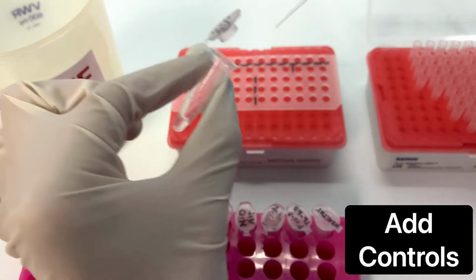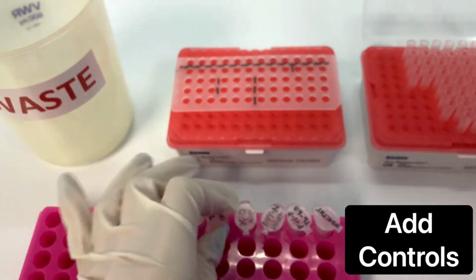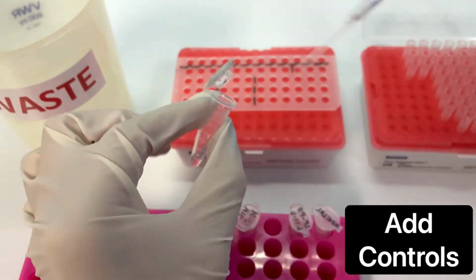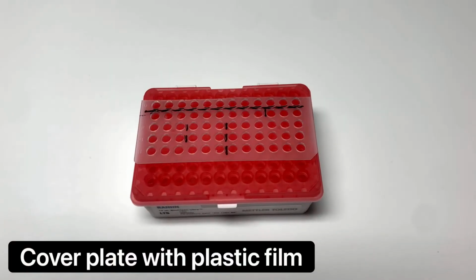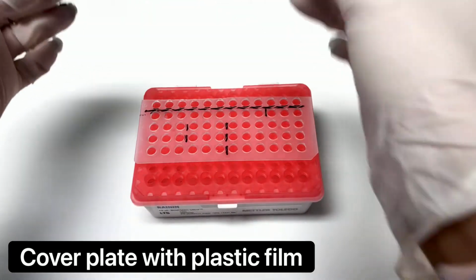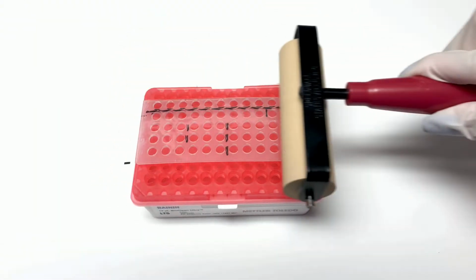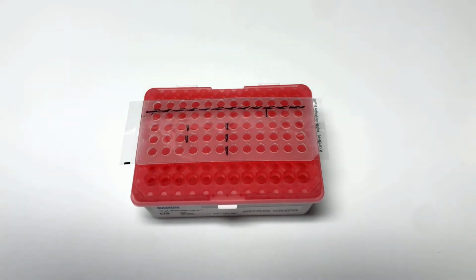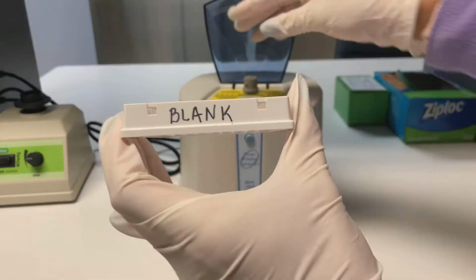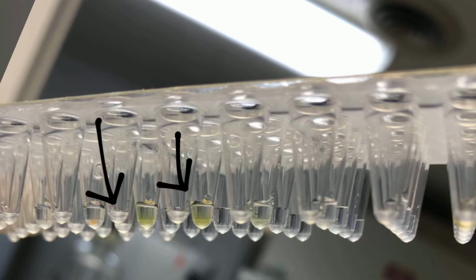Here we are going to add some controls. I have 6 various PVY strains courtesy of Alex Karasiv and a healthy control. Now we are going to cover our PCR plate with plastic film. Using a rubber roller, roll the plate to ensure a tight seal. Remove the plastic flaps. Briefly spin the plate to collect the water and the sample to the bottom of the well.